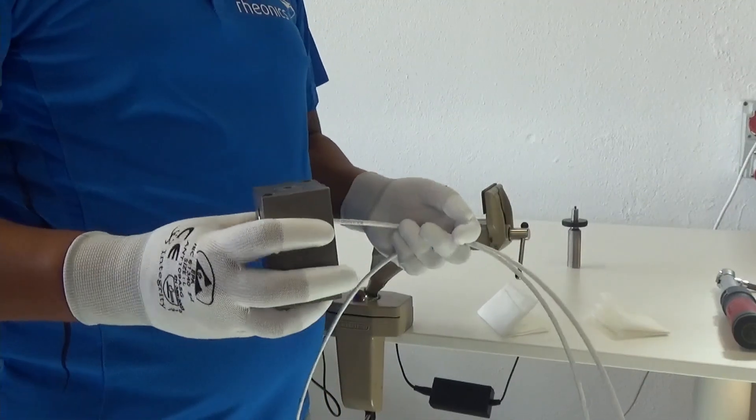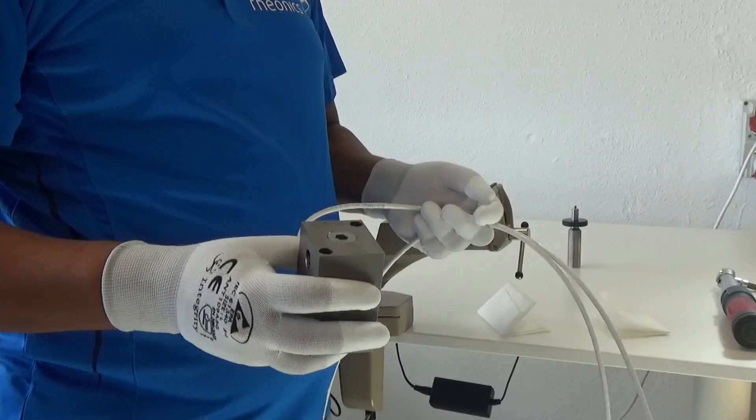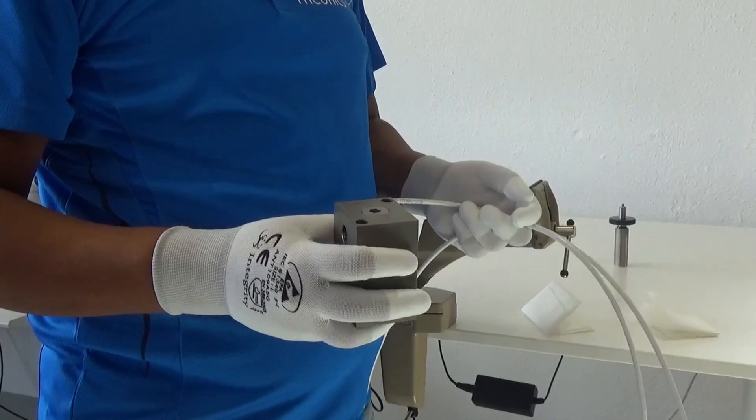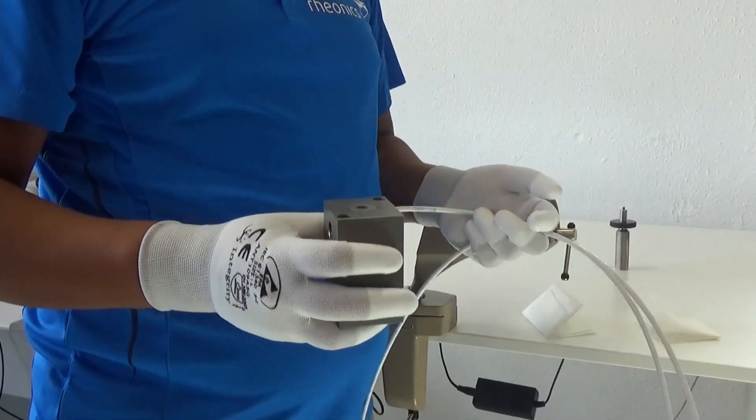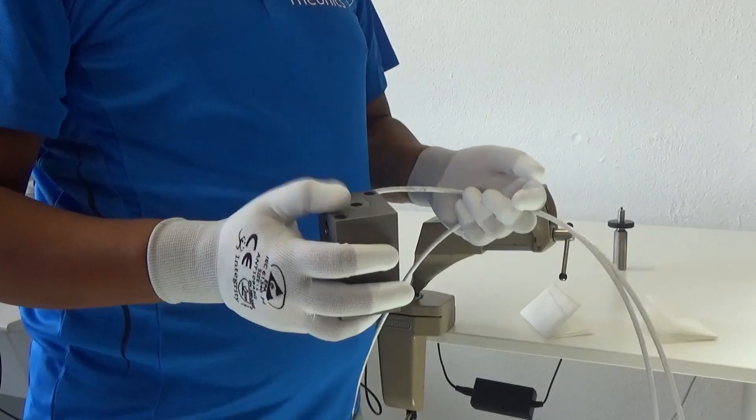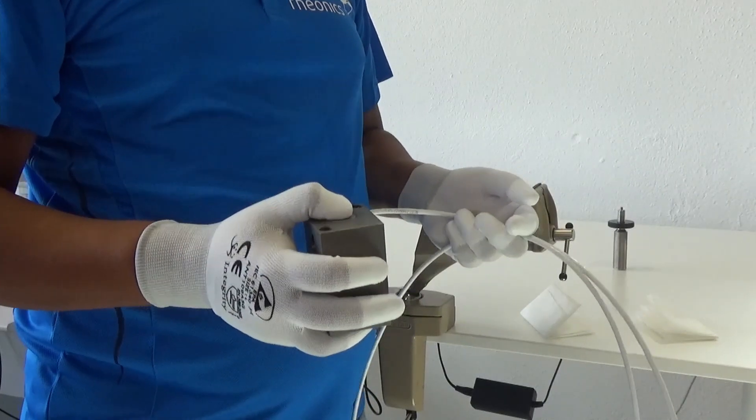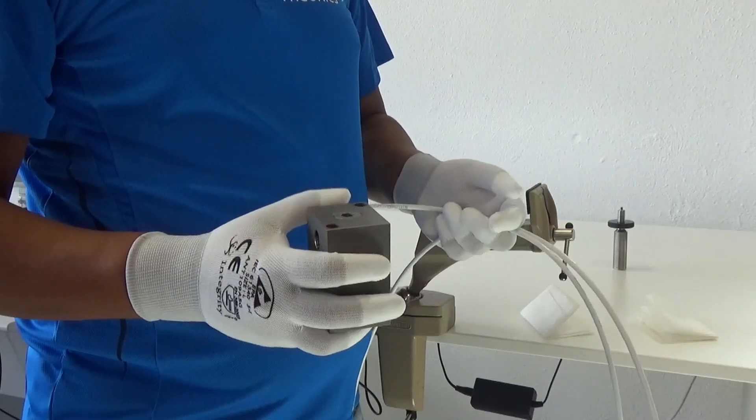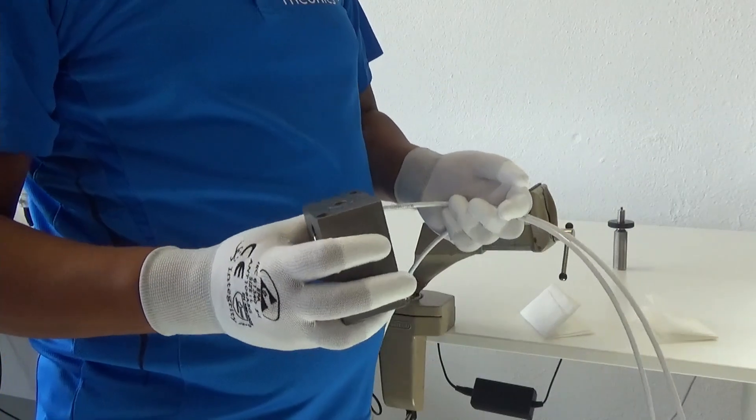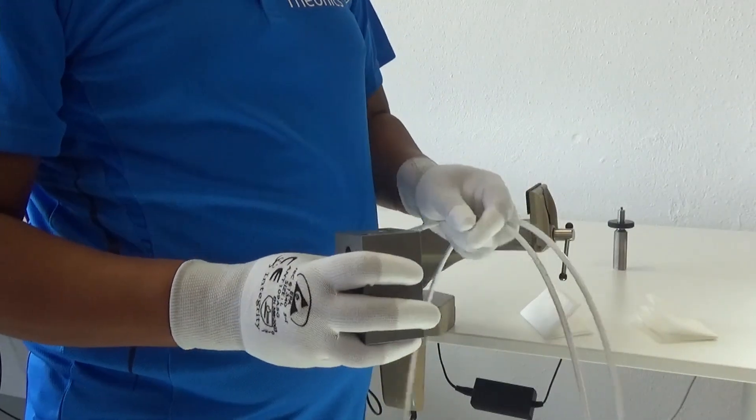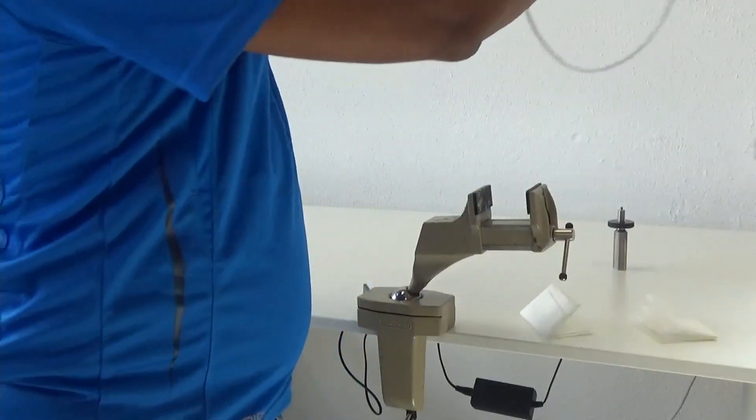In this segment I'm going to show you how to open it, clean the sensing element, and take a look at it if you expect that there might be some deposits or something. In general it's a good idea to open and clean that from time to time. You can also clean it in line by passing your solvent through the sensor body or module. This is the module and I'll show you the sensing element after opening it.